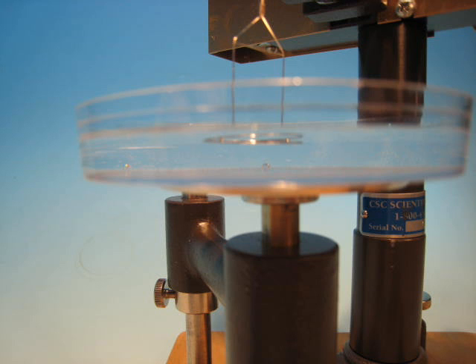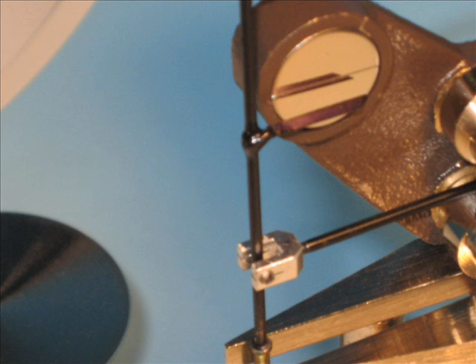The next step is to immerse the ring below the surface of the sample. The pointer should still be at the line on the mirror.